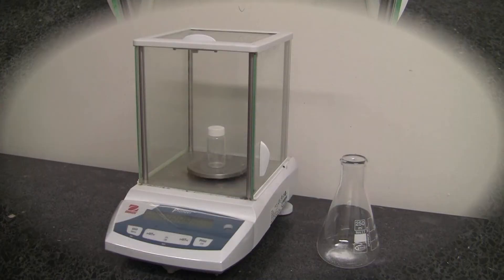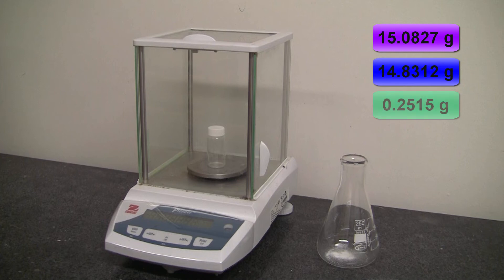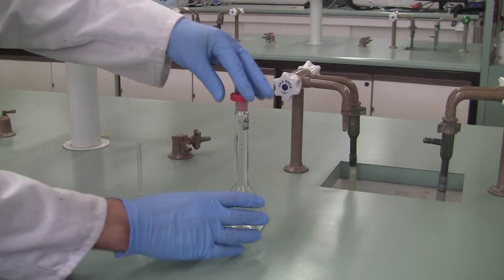The difference in mass between what you had earlier and what you have now is the mass inside your flask. You now know the exact mass that you've weighed by difference.